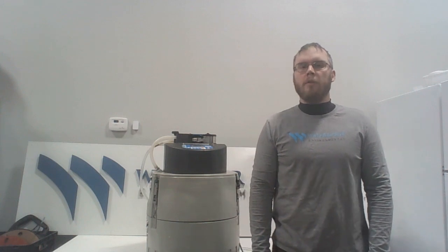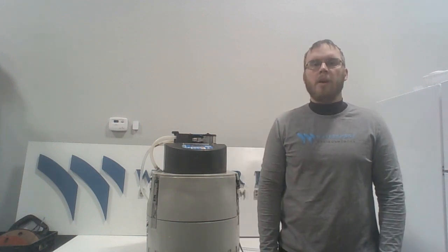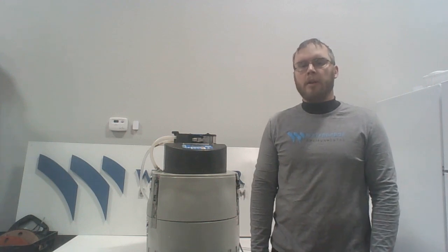Here at Waterborne Environmental, we've been using ISCO Autosamplers for over 25 years, and along the way we've learned some tips, tricks, and best practices to minimize the downtime for our sampling sites.